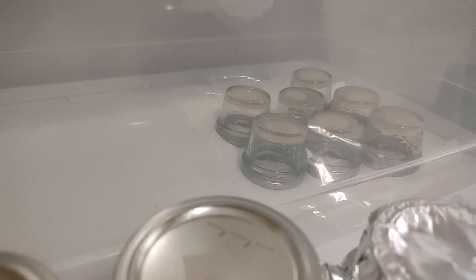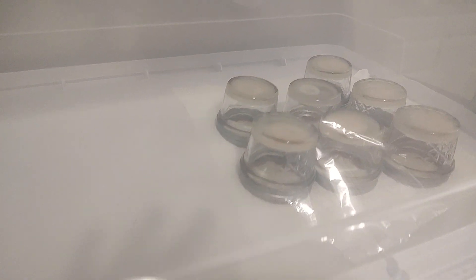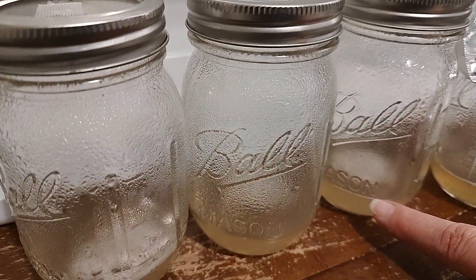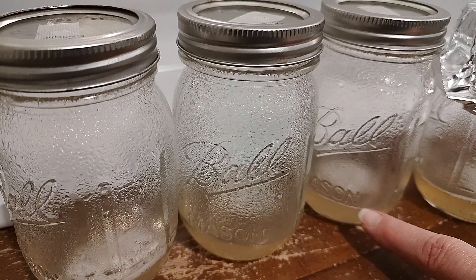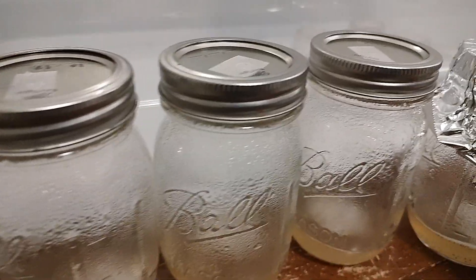We're excited about this. We're going to be putting transfers — taking a small transfer of each and putting them in the bottom tomorrow, after these pressure cook and cool. Allowing it to grow out to the edge, and then we'll be adding water that's been pressure cooked. We'll come back to update you on that.